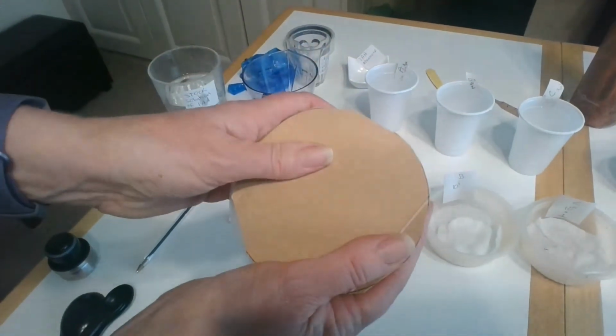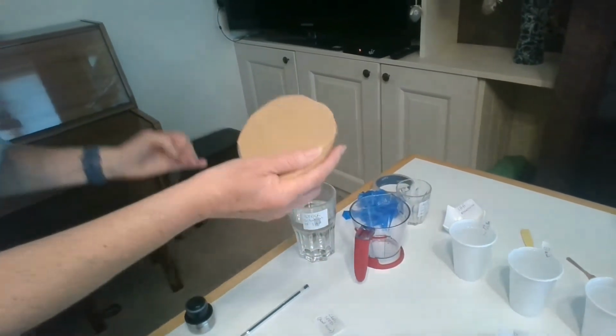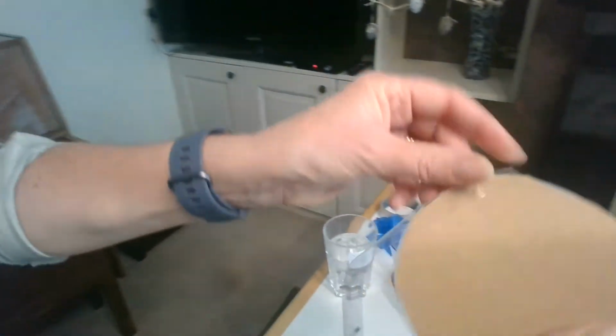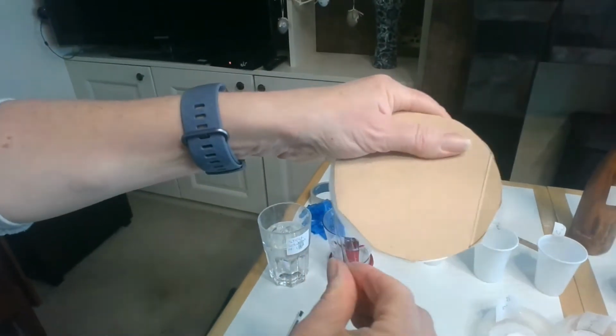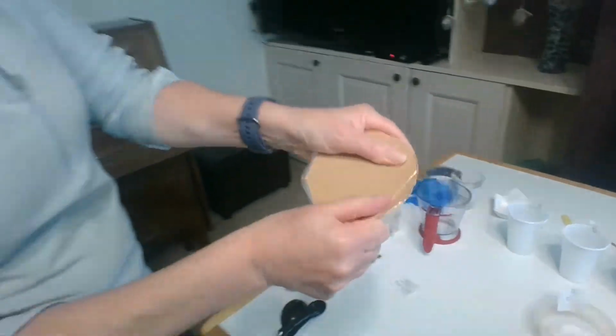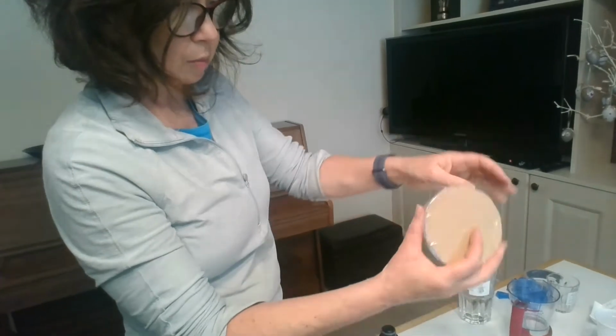I put my lid on and I get some parafilm, it sometimes says, but just some tape. So we're just using a type of sellotape. And if I can do this, it's going to be a bit tricky. I'm going to seal the lid. And this just makes sure that everything is secure. So the lid is in place. Everything is secure, the cotton wool won't fall out and my seeds are in place.